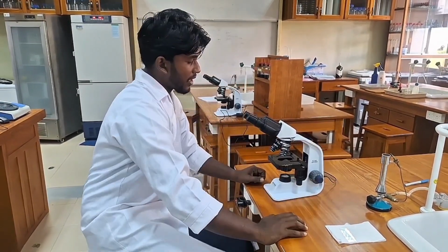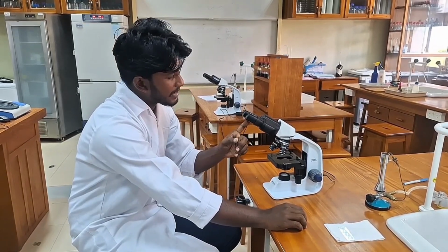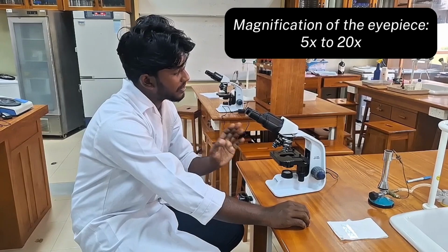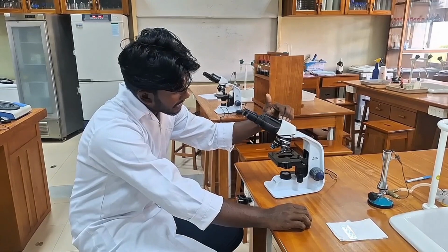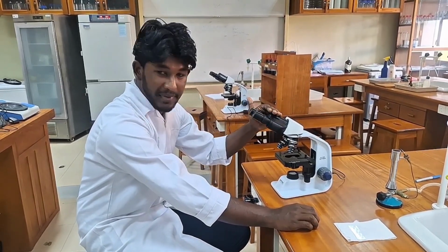And there are two sets of lenses. The first one is the eyepiece. The magnification of the eyepiece varies from 5x to 20x. In this case, we have a 10x lens. Then we have the center tube, which connects the objective lens to the eyepiece.